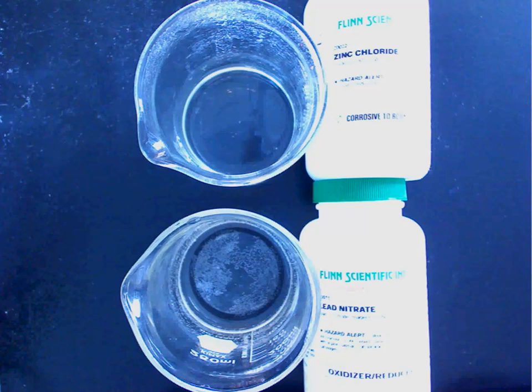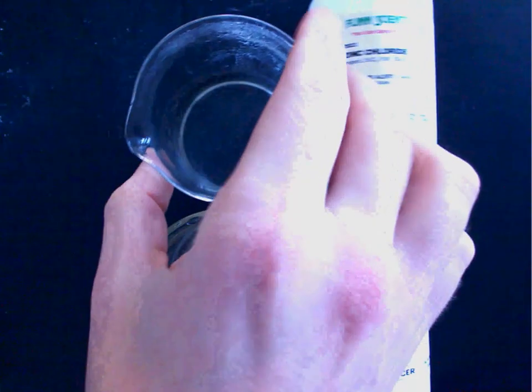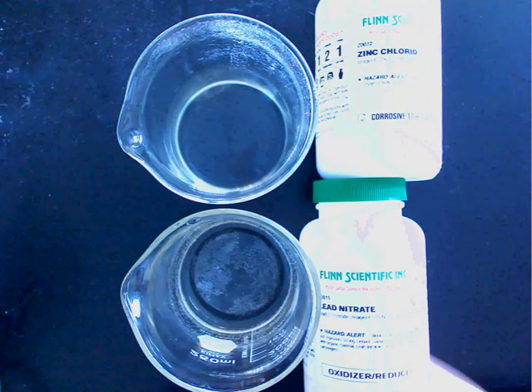Today we're going to be diving into double replacement reactions a little bit more. We've been doing so much work with all these equations and trying to figure out what the right compound formula is and all that stuff. I figured I'd actually show you a reaction. I mean, this is chemistry class after all. So on the screen you see two beakers, and each beaker has about 100 milliliters of water in it. You can't really see the water. You can kind of see it sloshing around there.